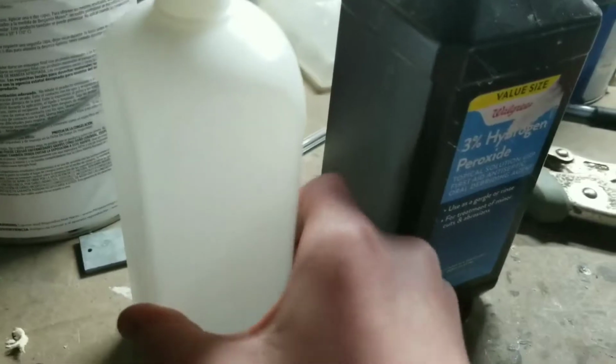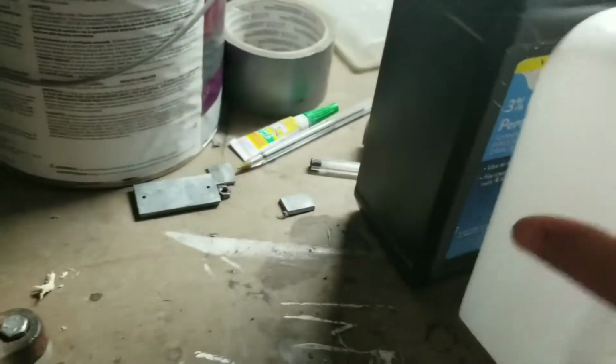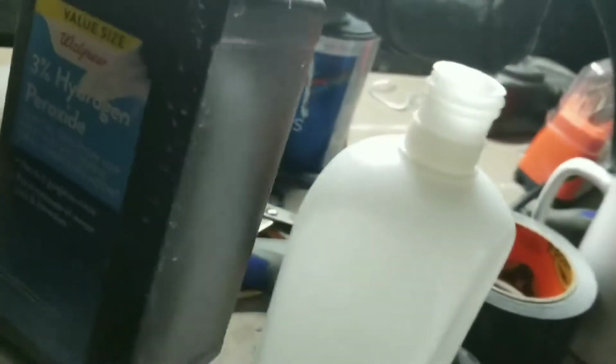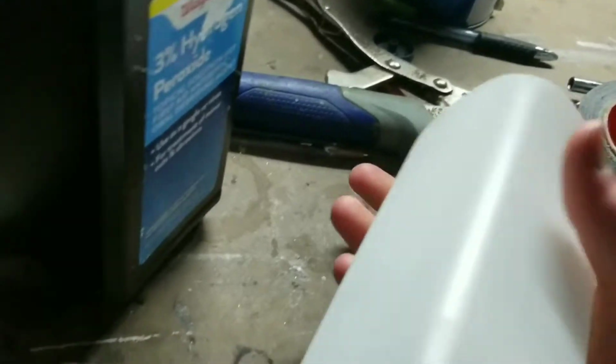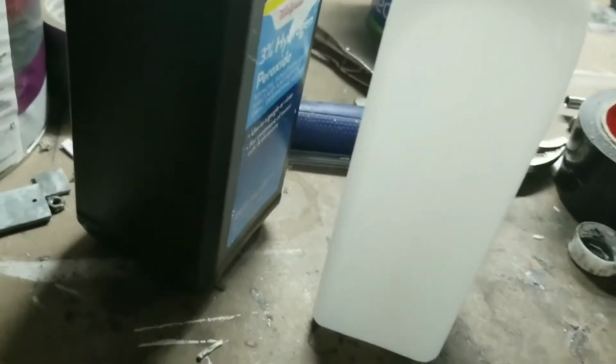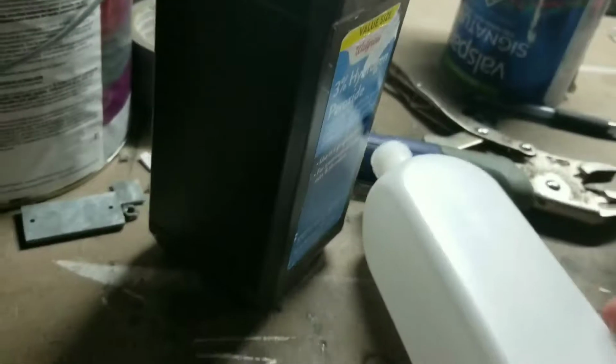Nonetheless, if you want to build a double cell electrolysis rig, first things first, make sure that you take two bottles of about the same height and size. This 3% hydrogen peroxide is about double the size, but it's about the same height. I'm probably going to replace this with another 100% acetone nail polish remover bottle eventually, but I haven't gotten to it yet. Nonetheless.